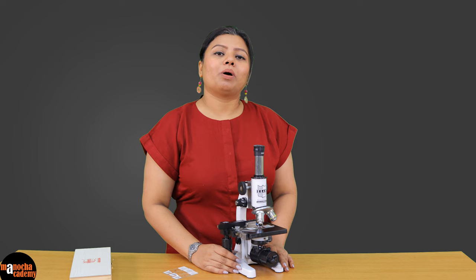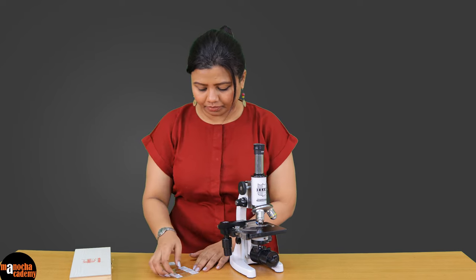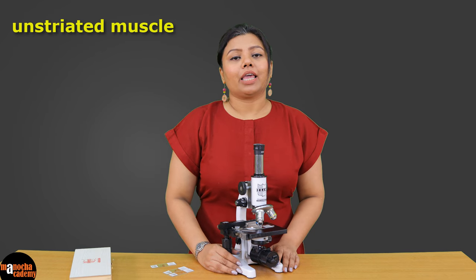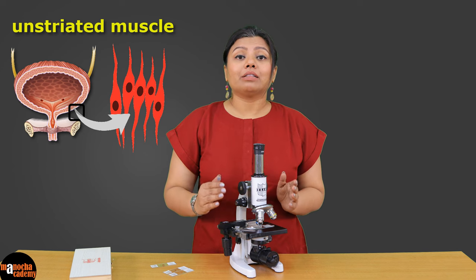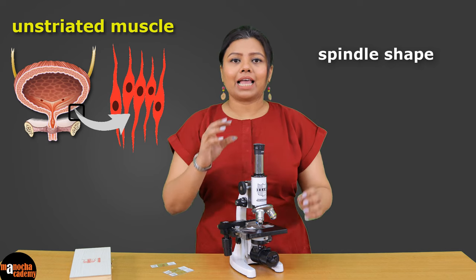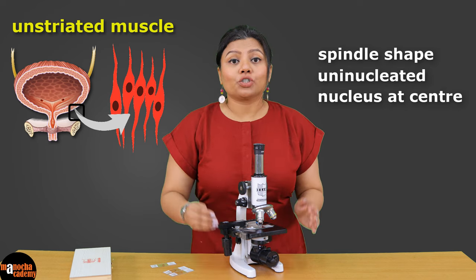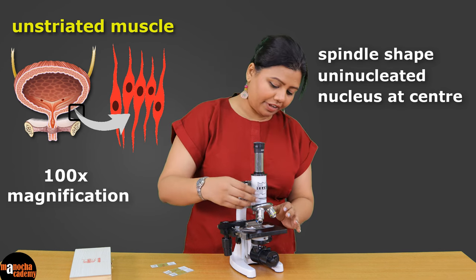We move on to the next muscle which is unstriated muscle. Unstriated or smooth muscles are present in the wall of hollow organs other than the heart. These muscles are spindle shaped, which means they have tapering ends and are broad at the center. They also have a single nucleus located right at the center. Let us see how it looks at 100x magnification.